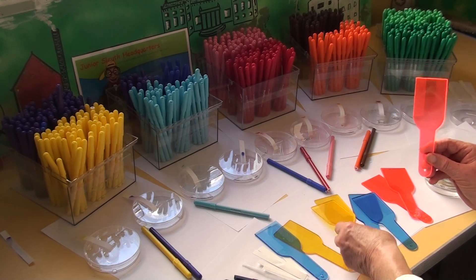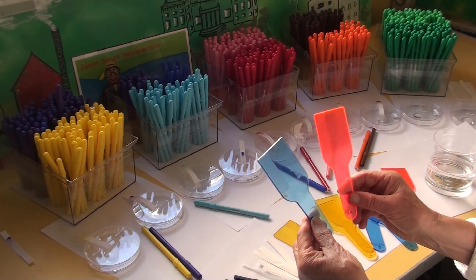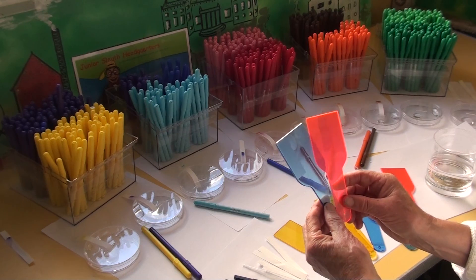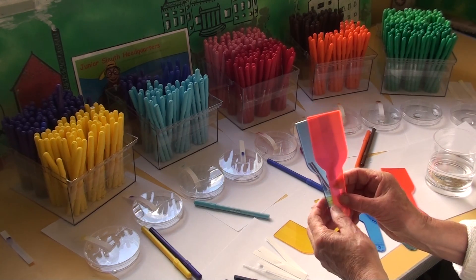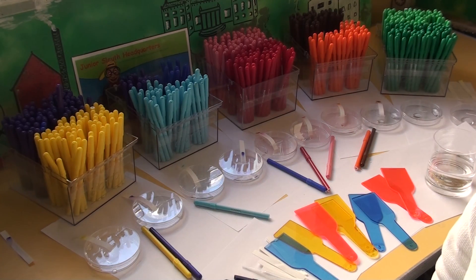The last one of course is: what colour would I get if I mixed red and blue? By this time the children are all quite enthusiastic, and most of them know the answer, and you mix it and you make purple. Now you see, that's all the colours in the rainbow — let's try and make a rainbow.